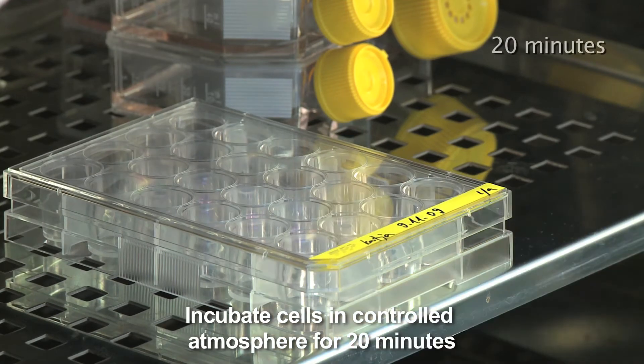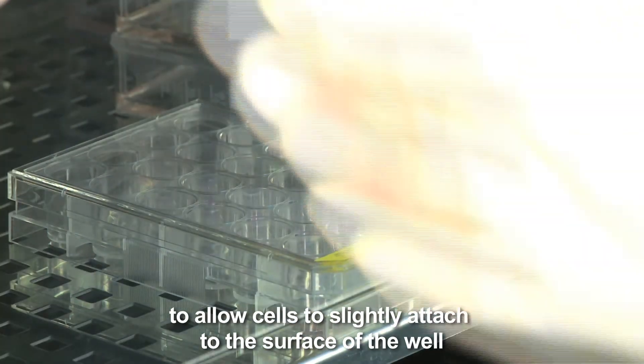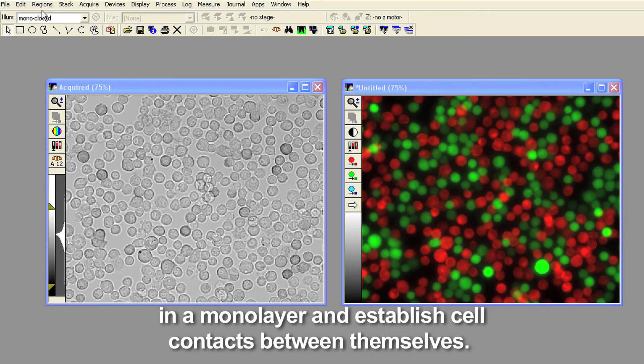Incubate cells in a controlled atmosphere for 20 minutes to allow cells to slightly attach to the surface of the well in a monolayer and establish cell contacts between themselves.